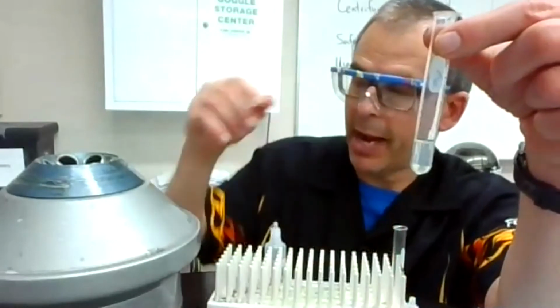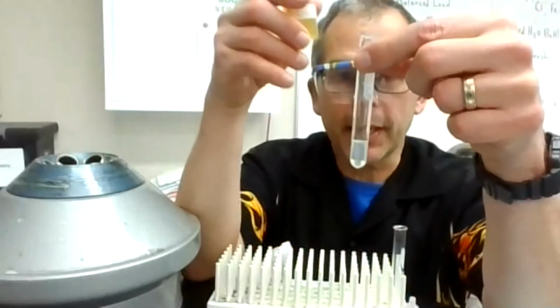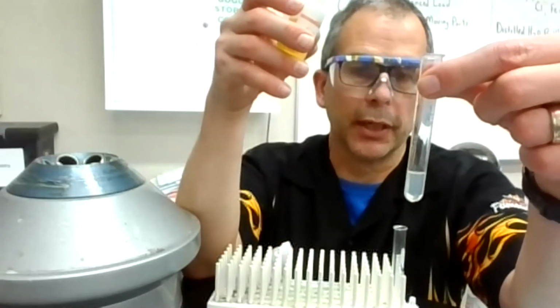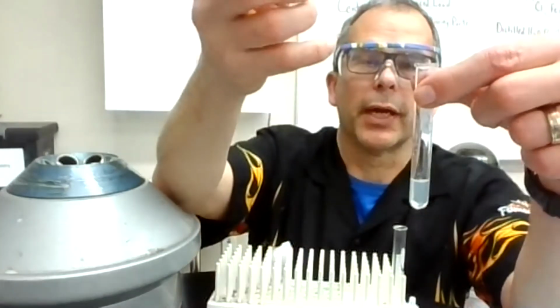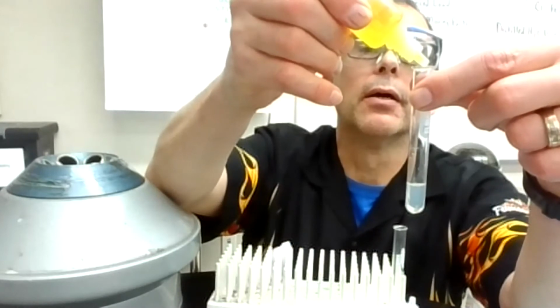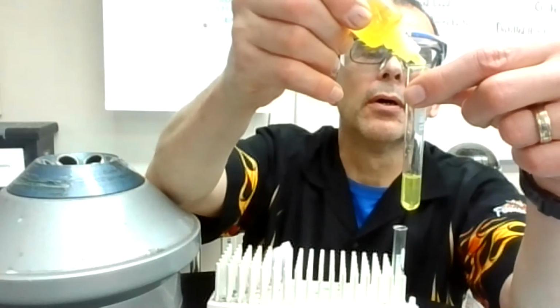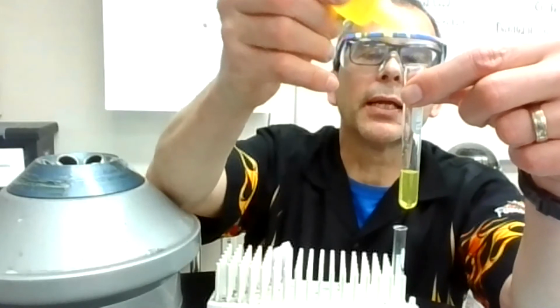I'm going to add the next substance. And again, if you're going to be getting a precipitate, you should see cloudiness as I add the drops. It should significantly stand out more than the haze background that you already have. And it's probably easiest to see as you add the drops what's going on. So I'm going to add these drops. It's turning yellow, but it might look a little different in the video, but it doesn't look like there's any more haze.